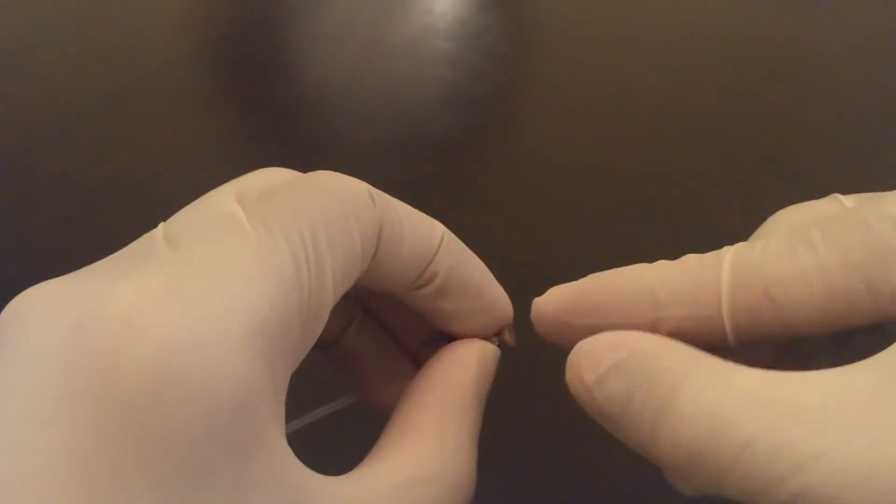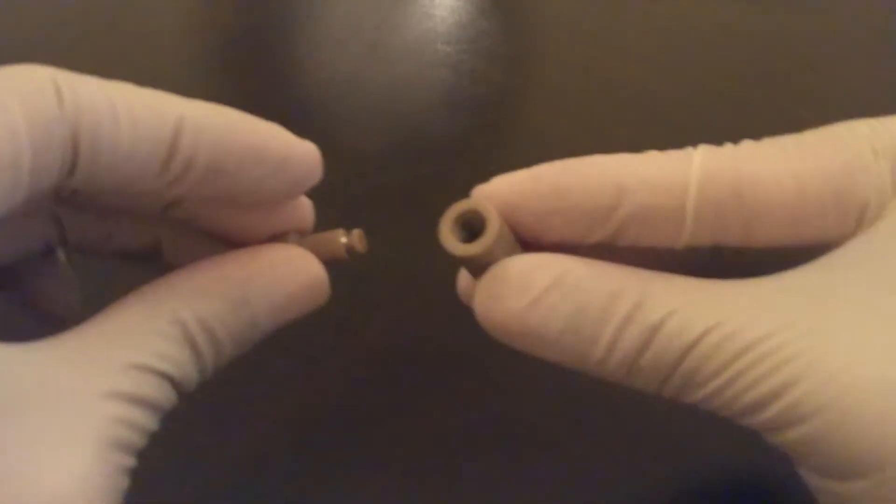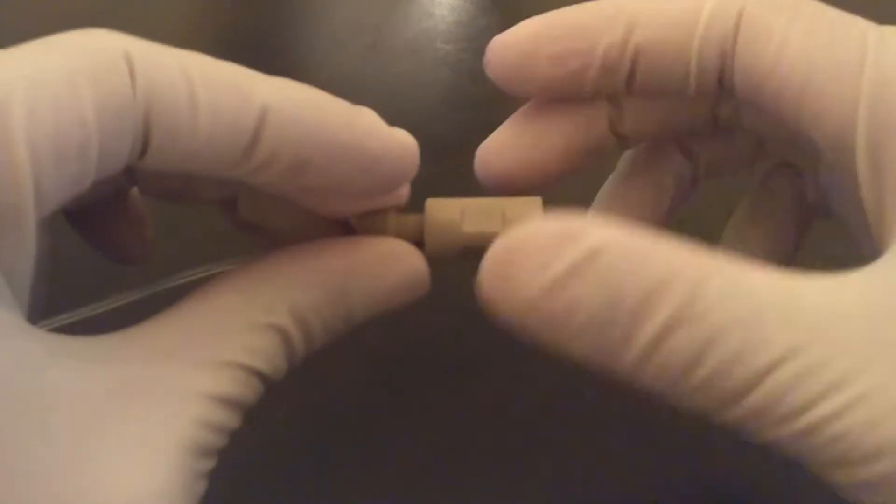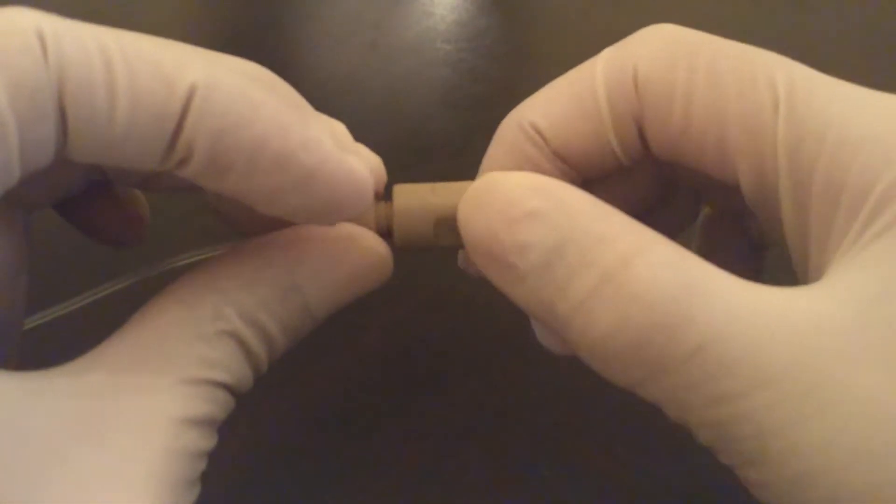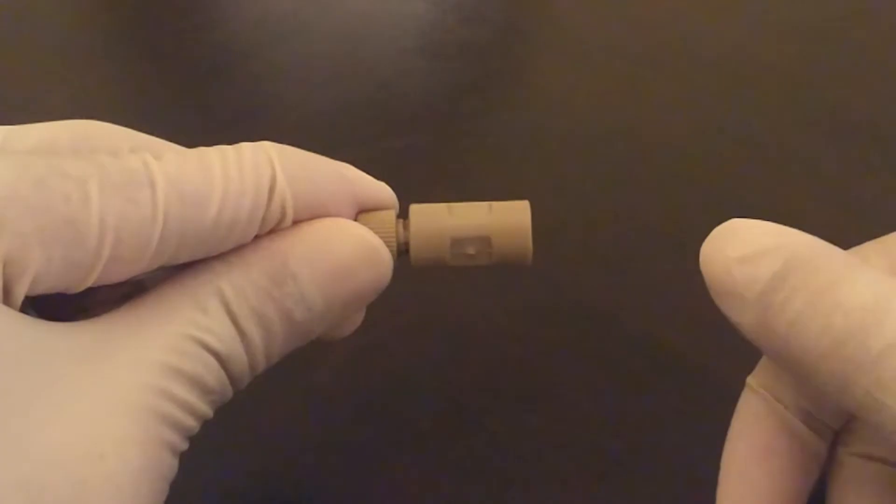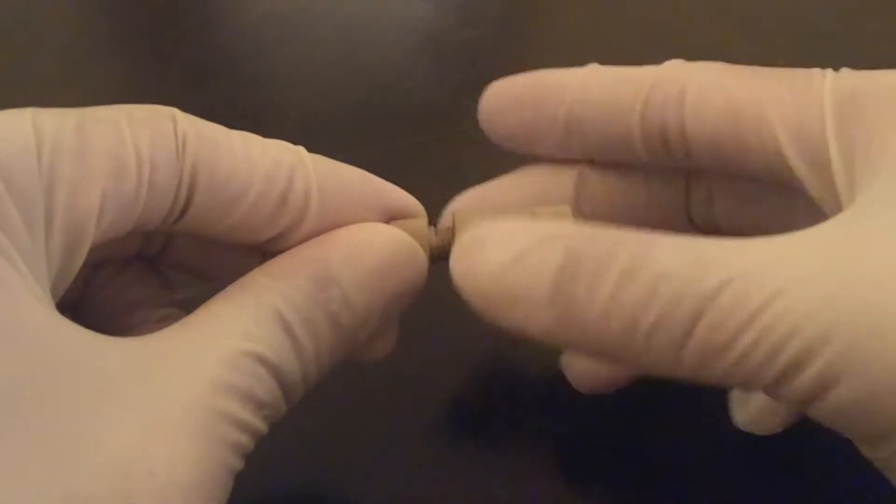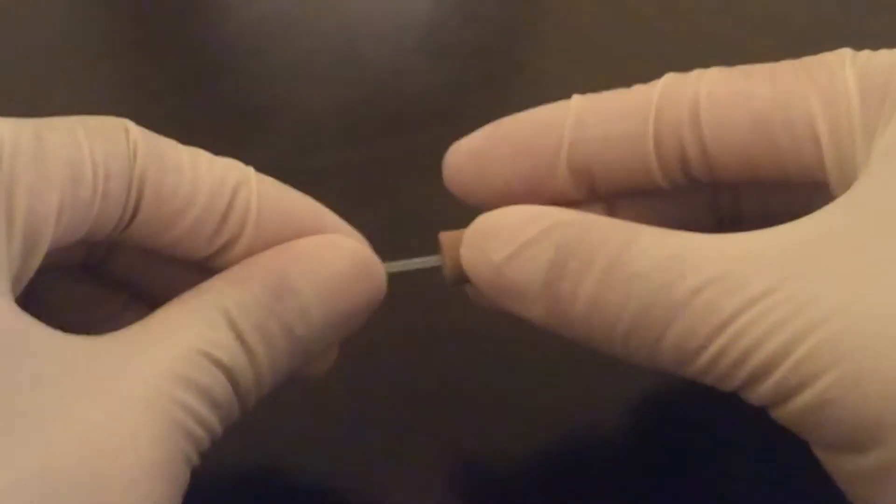Use a union to thread onto the nut. Tighten the complex so that the tubing and the ferrule are flush. Ferrule should be tightly bound around the tubing. The nut may freely move along the tubing length.